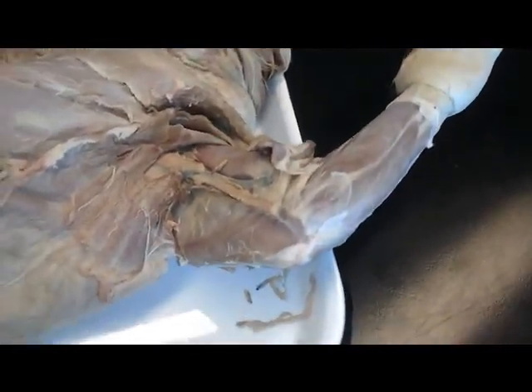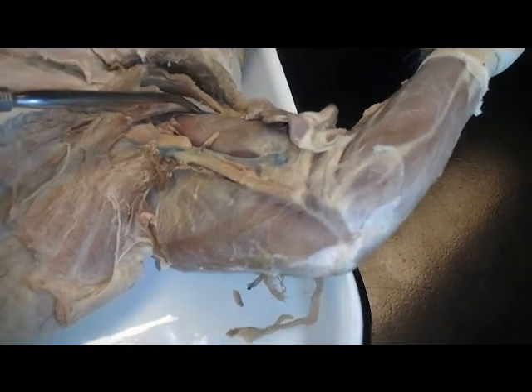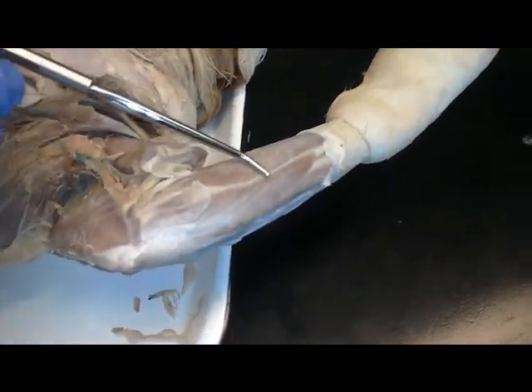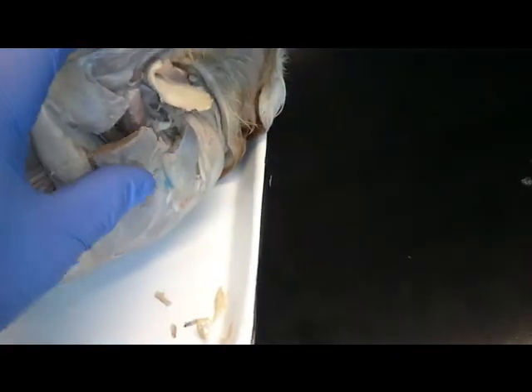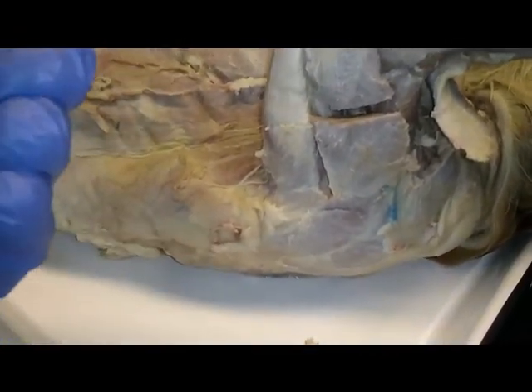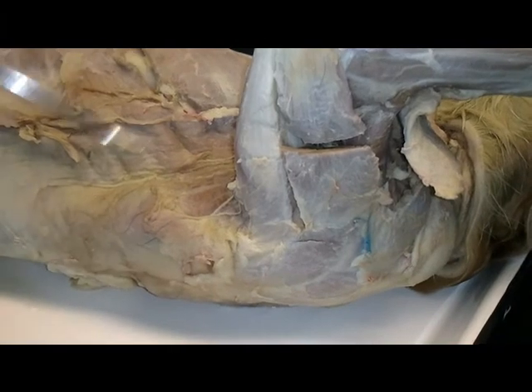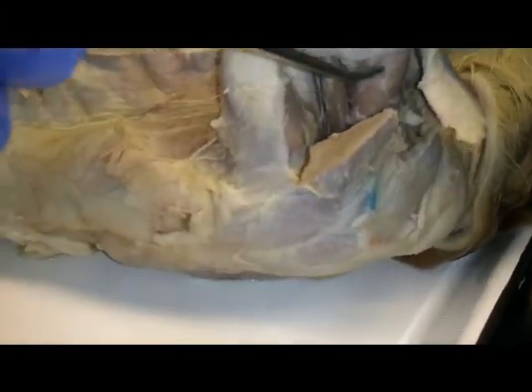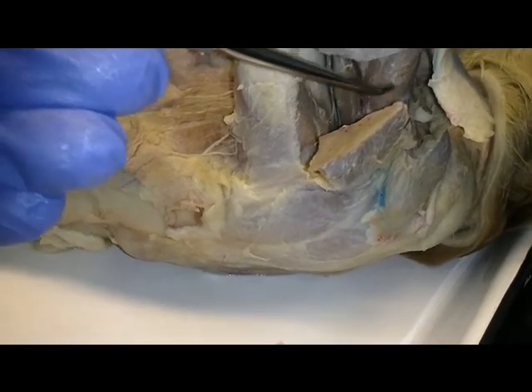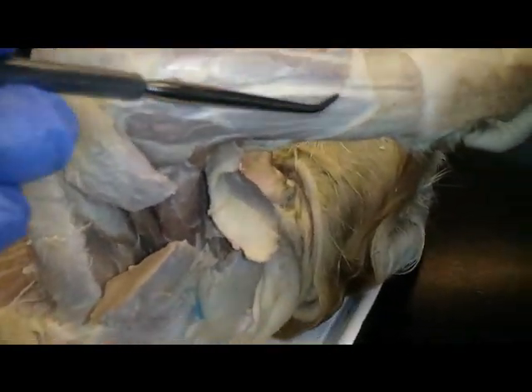For the muscles that consist of the arm and forearm, first we have the anterior arm compartment, which here, underneath the pecto antebrachialis, would be the biceps brachii. In the anterior forearm, we have the digital and carpal flexors. Moving to the posterior side of the arm, we have the tricep group, which this is the lateral side of the cat. So this would be our lateral head of the tricep here. Underneath that, we have the long head of the tricep, and deep to the lateral head, that little guy in there would be the medial head. Anterior to the medial head of the tricep, which is here, we have the brachialis. Also, to the posterior forearm, we have the digital and carpal extensors.